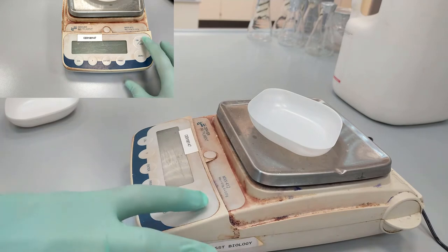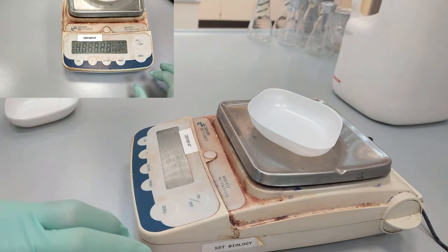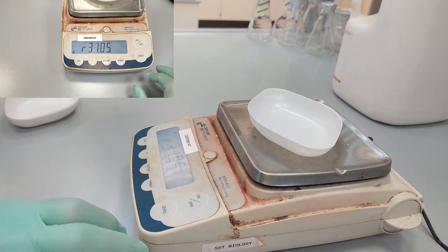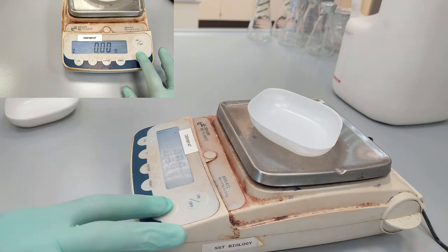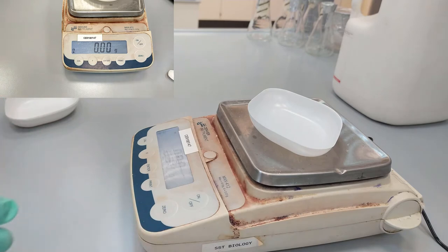First, we turn on the scales and then wait until the level is zeroed. If it's not zeroed, you're going to press on the zero button and in this case you level down the weight on the scale.